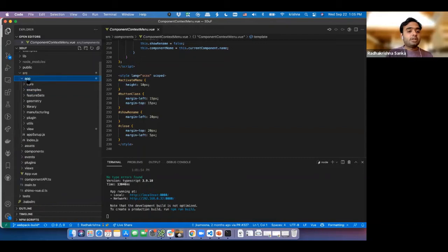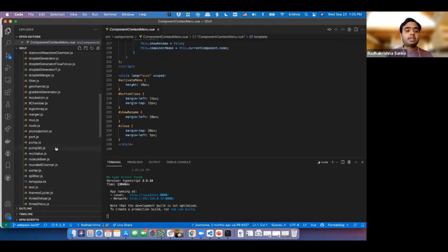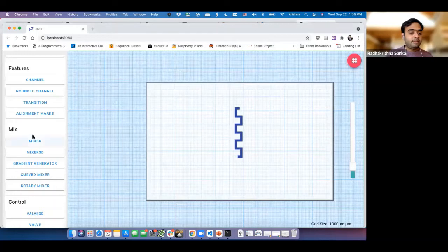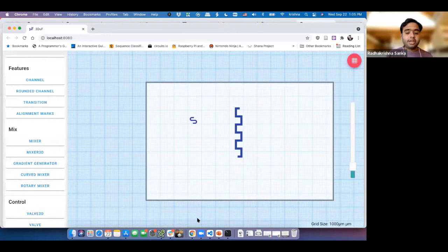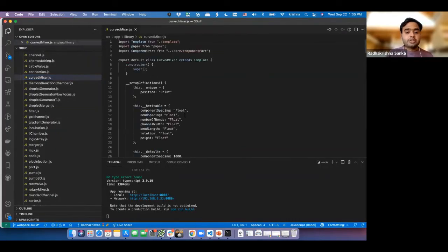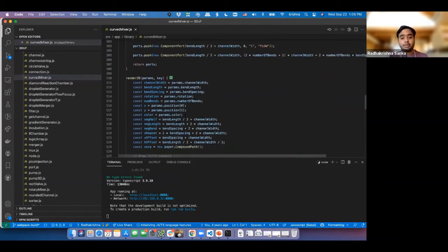The second part of what we need to do is tell 3DuF how to understand a new thing, a new component like the triangle trap. If you go to the library folder over here, you will have about 40 different files, one for each individual thing. Like the mixer, which we used earlier, if we use a curved mixer, all its properties and drawing code and everything is isolated inside that curved mixer.js. So we have some standard ways of defining these functions, and by just copying that, you'll be able to do it.